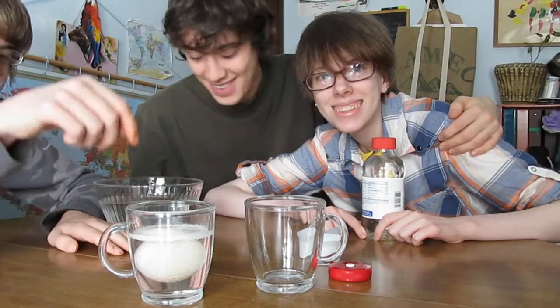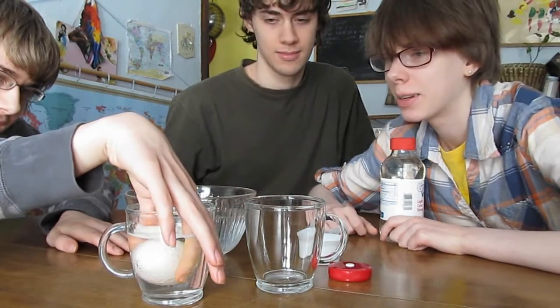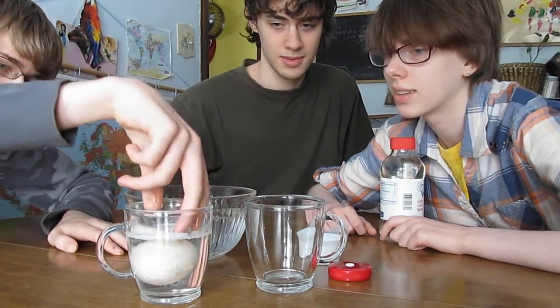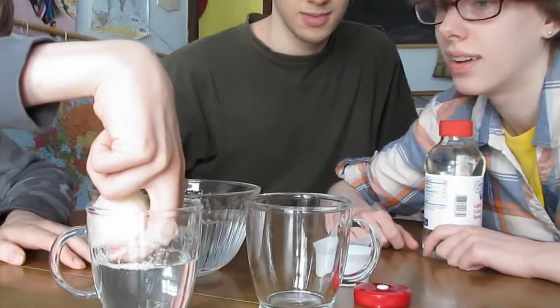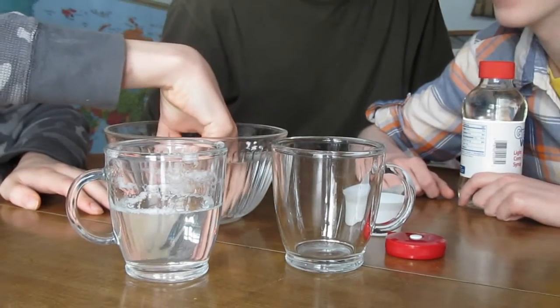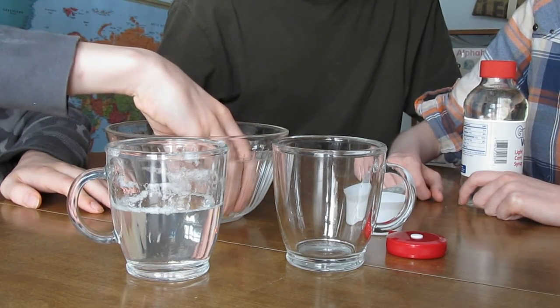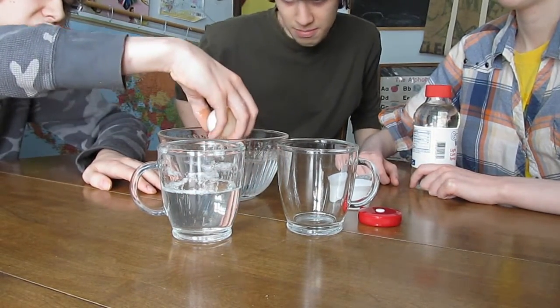We're back and ready to continue our experiment. We're going to rinse the egg. Do you use more than two fingers? He's trying to rinse the egg off. Does it have the shell on it still or is the shell gone? No it doesn't. I think we should take it in the other room and rinse it off, because it's still got some crap on it.